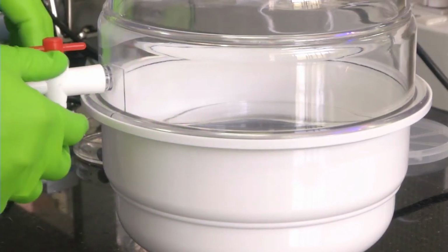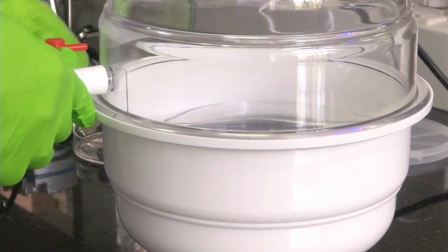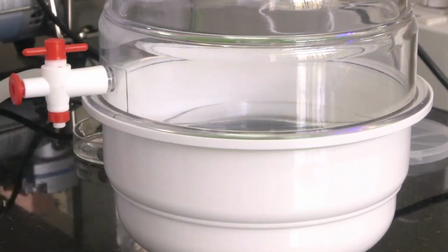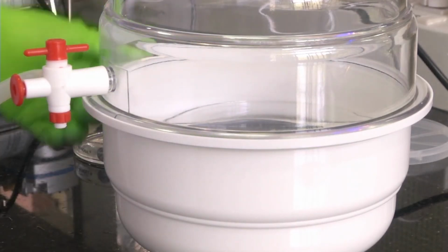These air bubbles also we have to remove now. So what we will do, we will again desiccate it. Now this process is very clear to you. We have to desiccate it now. We have connected the pump. Now we are taking out air from it. So this will remove the air bubbles the second time.